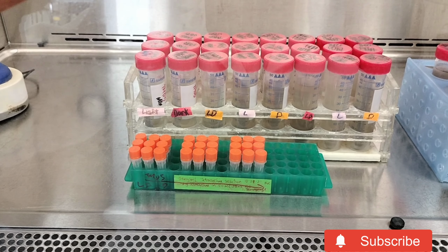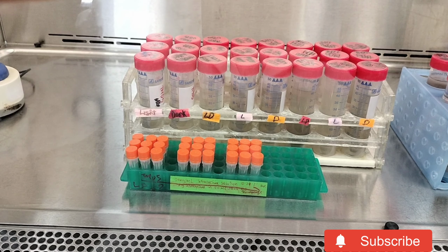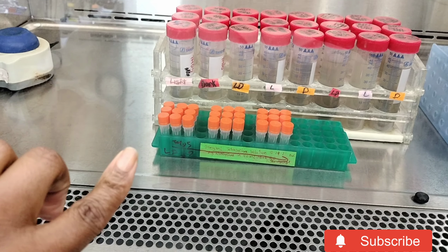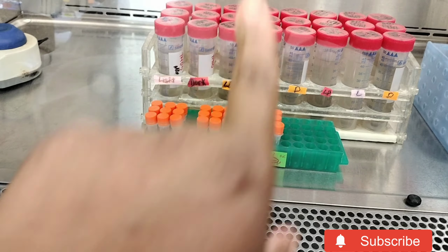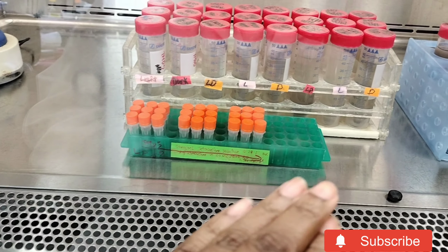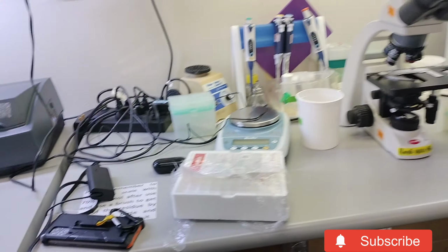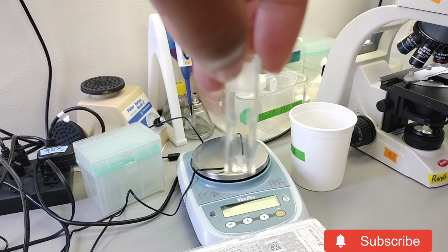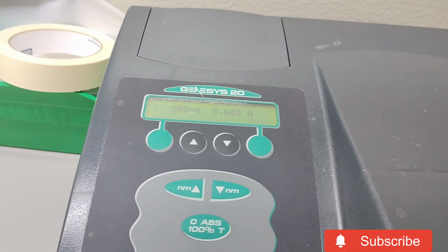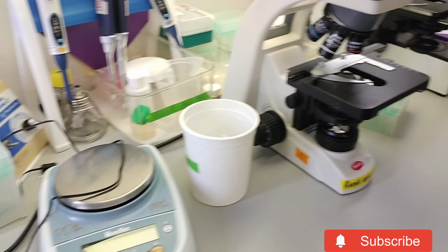I'm going to aliquot 1 ml or 1,000 microliters from the tube with the red top into each of the tubes with the orange top, in the appropriate tube. I have them lined up so they match these. And once that's done, I'm going to put them into cuvettes. Oops, it's not focusing. Yeah, into cuvettes. It's already set. Blank and take the reading.